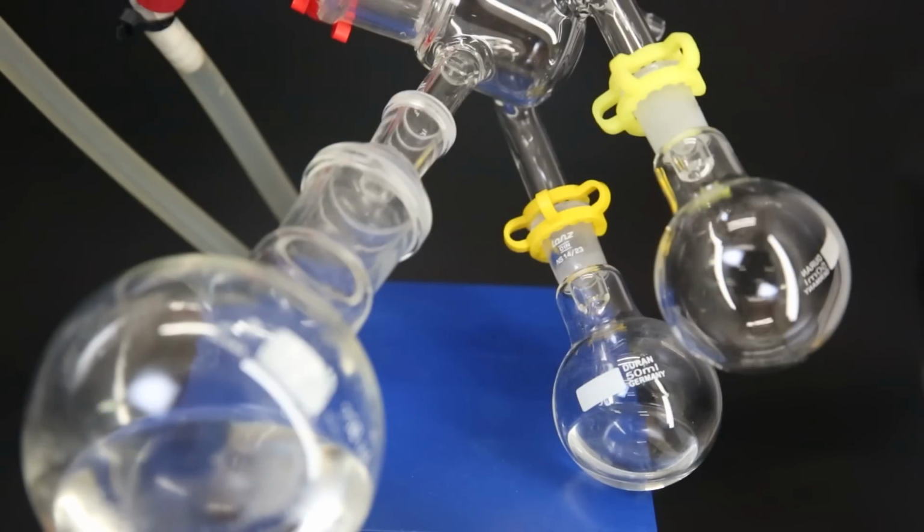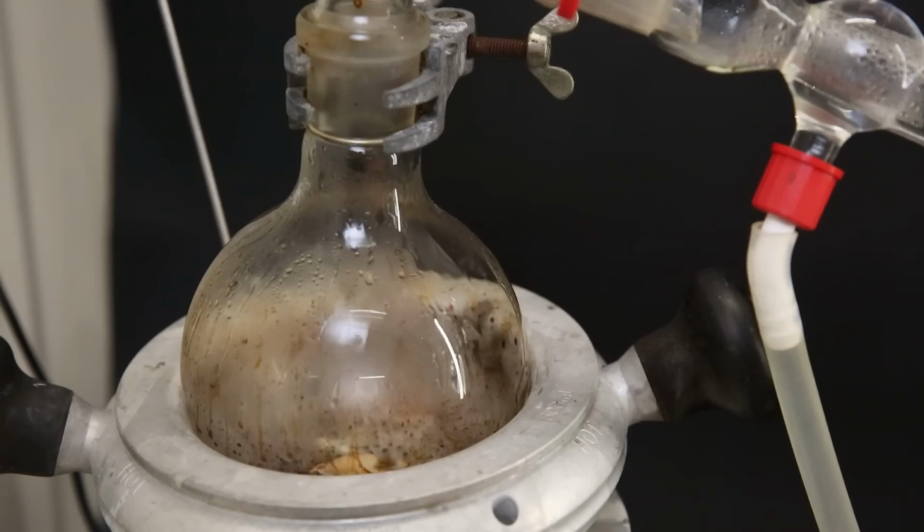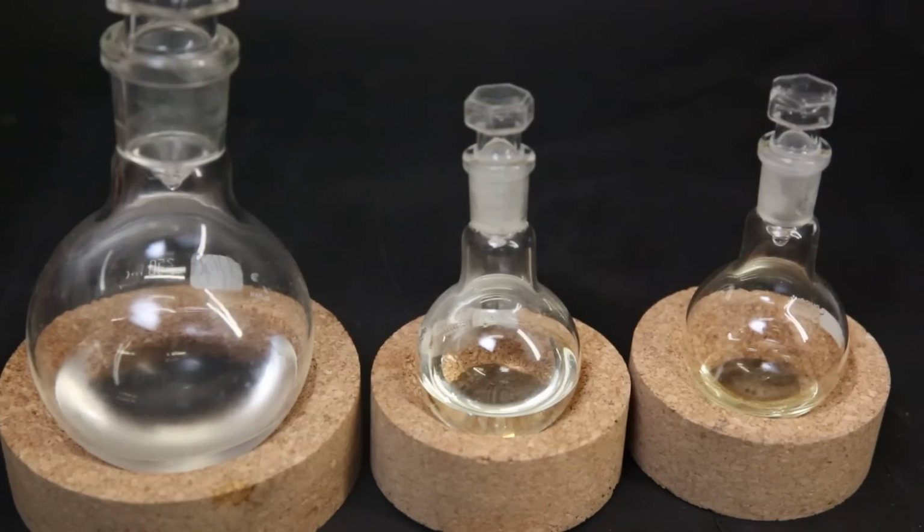around that temperature. Then I turn the cow adapter and increase the temperature to start collecting the next fraction. After a while, I turn it to the other side and collect the remainder in the other flask. When basically everything is boiled over, I stop the distillation. So now I am left with 3 flasks, which all might contain part of my product.